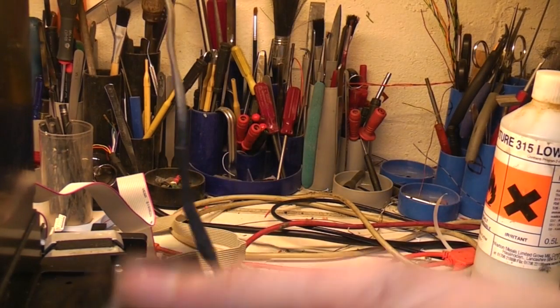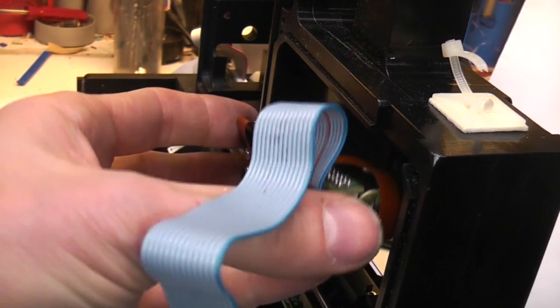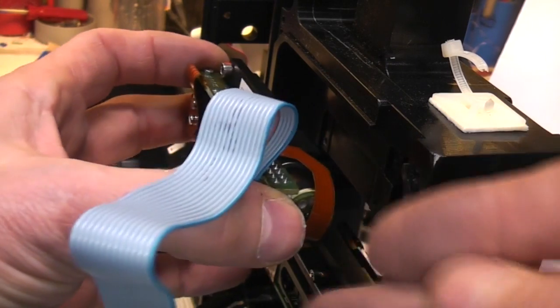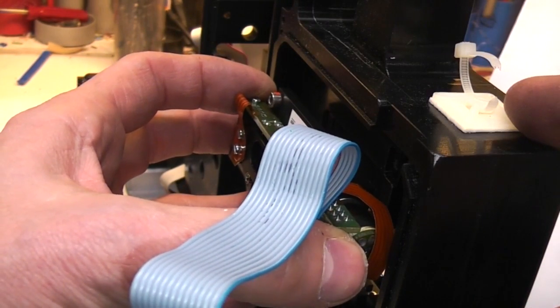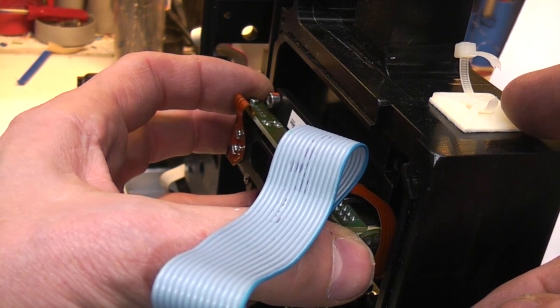And then these other two slits further cut that light. So if we stick this one back in, you can see a very small section of the light gets through there, and again that's adjustable. Similarly, this other one does the same thing for the other side, so it looks like you can basically do a high pass and a low pass, and then filter that subsequently to get all sorts of different permutations of filtering on the light that comes through.